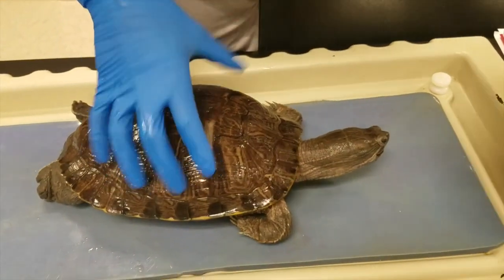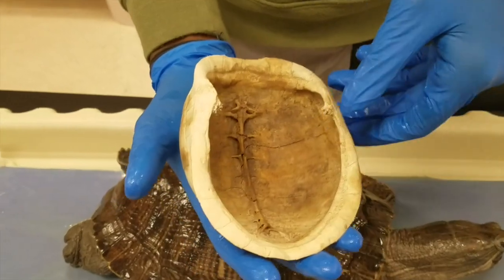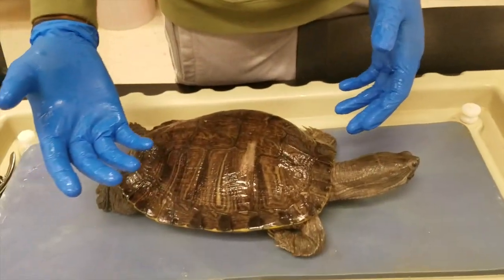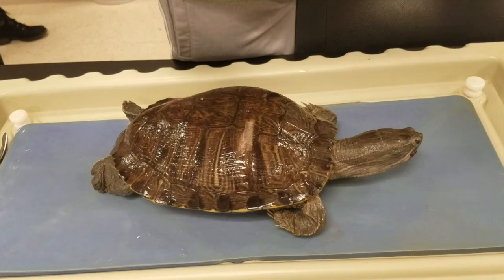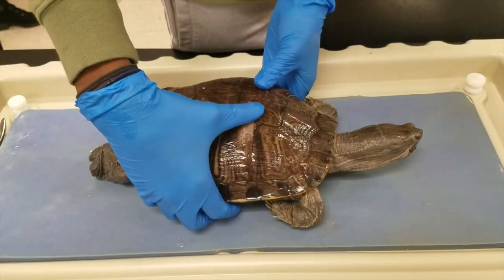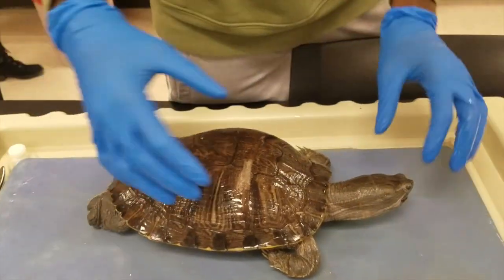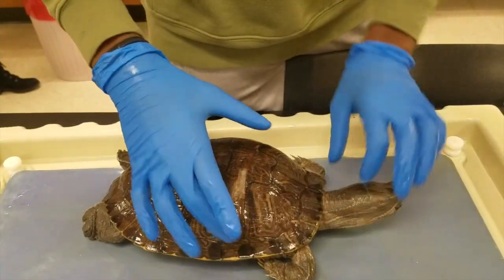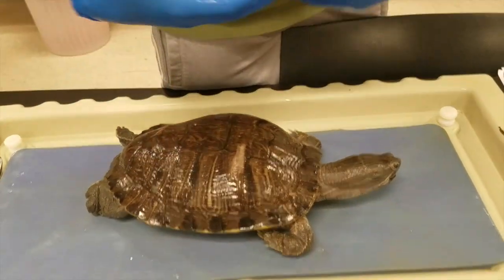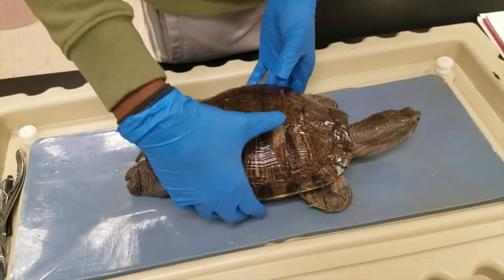One thing we'll notice about the shell is that the spine and ribs are actually fused into it. This is important because it doesn't allow for their insides to expand like it normally would if you had a diaphragm. So instead of having a diaphragm, turtles use their neck and other limbs in order to breathe and create the tension needed to inflate and deflate the lungs.